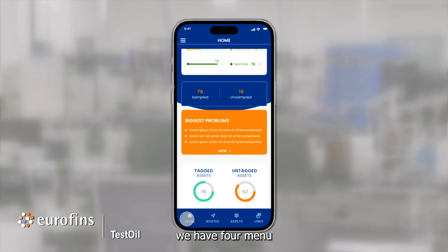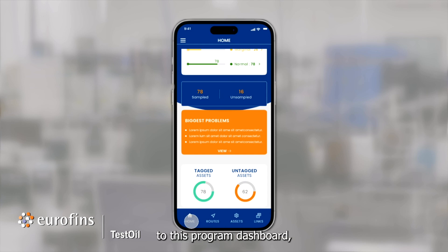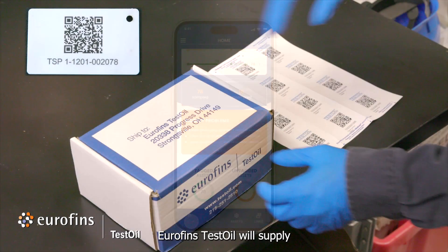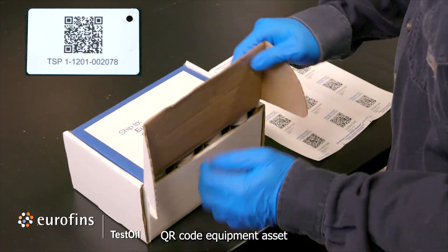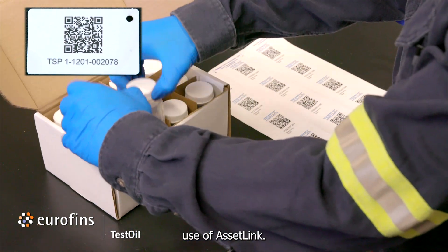On the bottom, we have four menu options: Home, which brings us back to this program dashboard, Routes, Assets, and Links. Eurofins TestOil will supply QR code equipment asset tags and sample bottle labels to facilitate use of AssetLink.